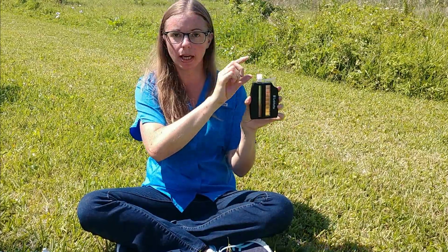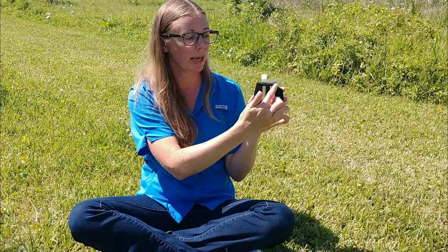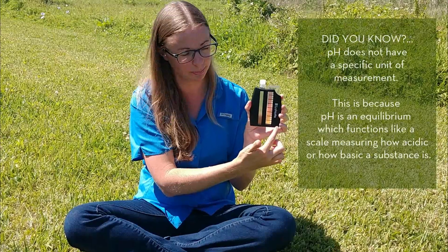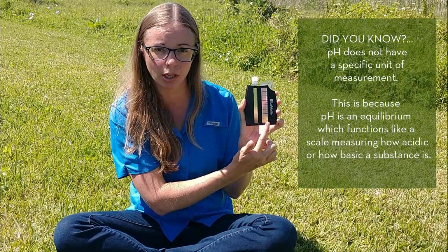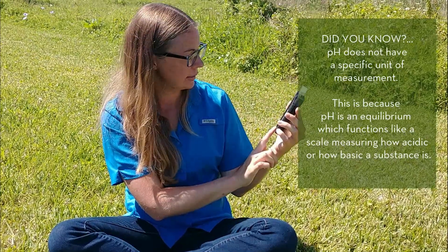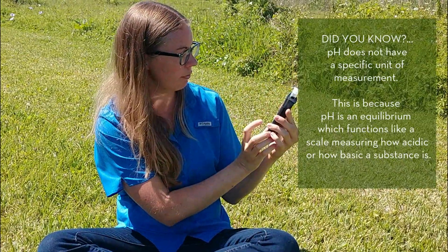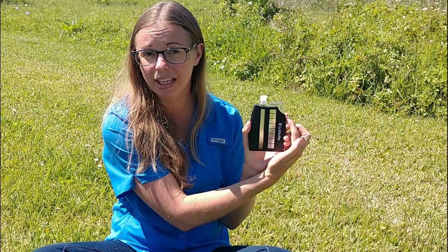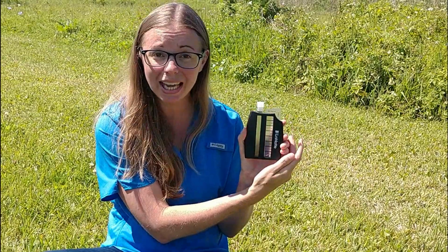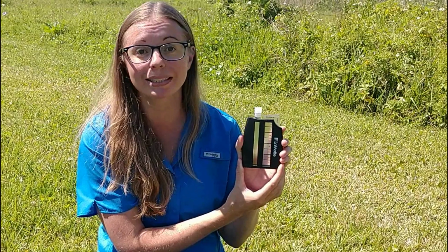I'm going to take my color comparator, I'm going to put the vial in one side, and on the other side is my scale for my pH range, and this one goes from 3.5 to 6.5. So I'm going to take a look to see if the green matches up with any of the colors on this scale. And it doesn't look like it, so I'm going to take the second scale, which goes from 7 to 10.5, and it looks more like our green color matches up with a pH level of 7, 7.5. So today, May 5th, 2020, our pH level of the St. Johns River is around a 7, 7.5.